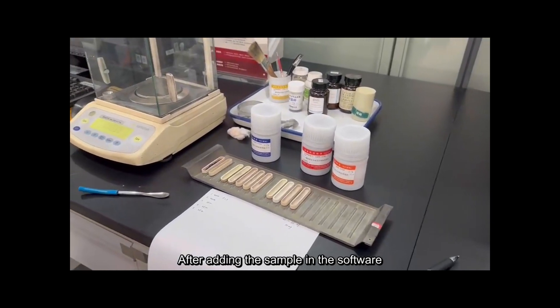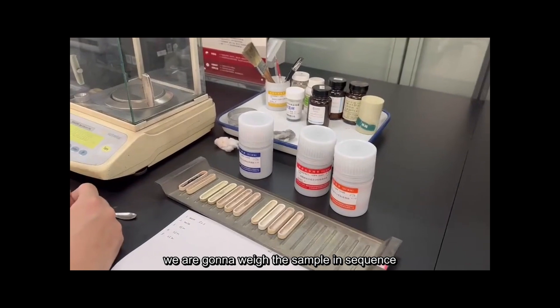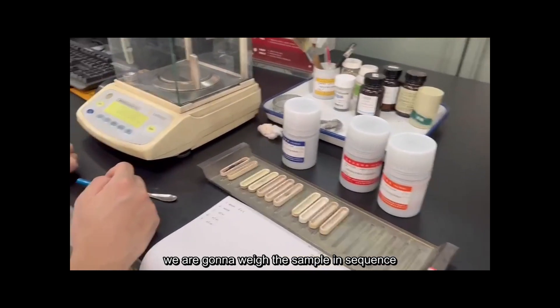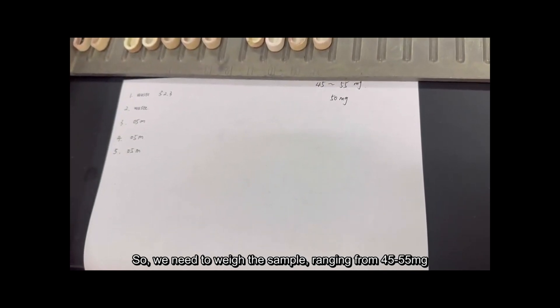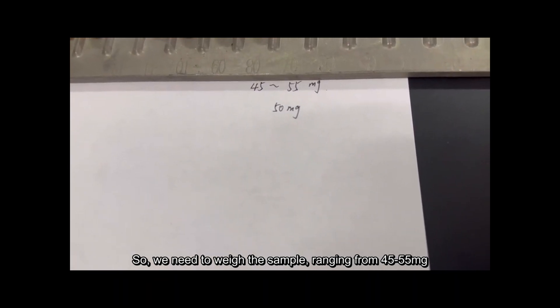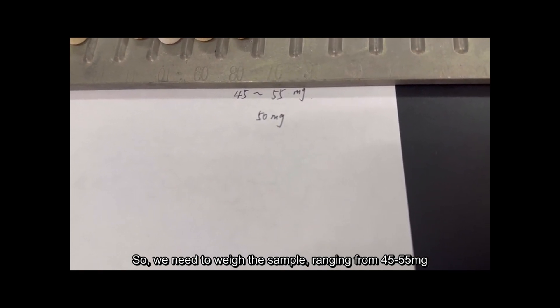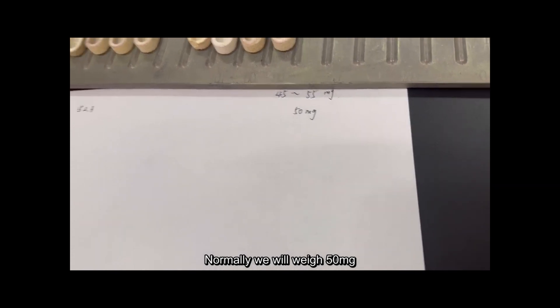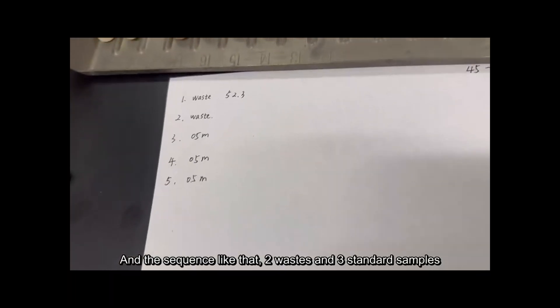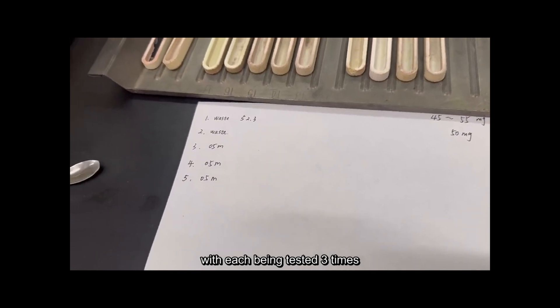After we add the samples in the software, we are going to weigh the samples in sequence. We need to weigh the sample in the range of 45 to 55 milligrams — normally we weigh 50 milligrams. The sequence is: two waste samples, then three standard samples, each tested three times.